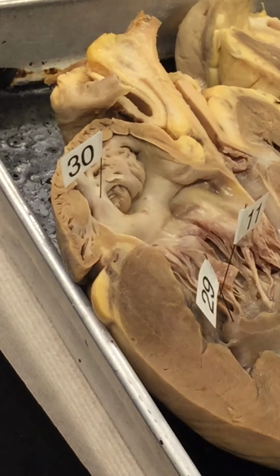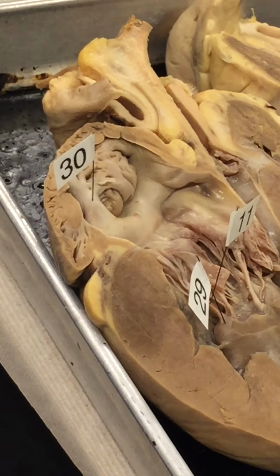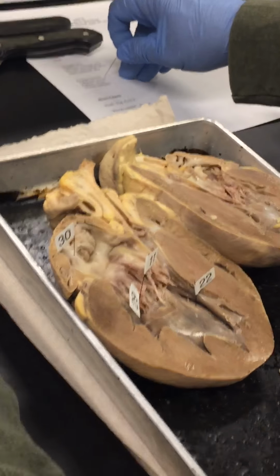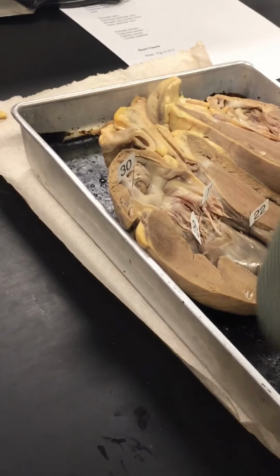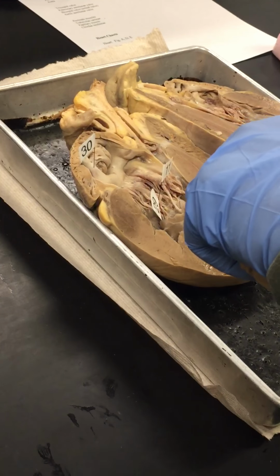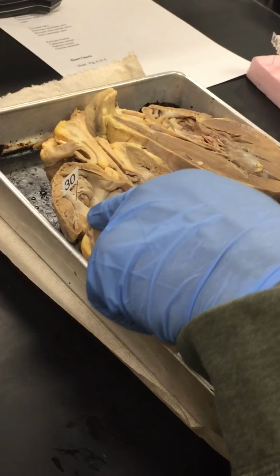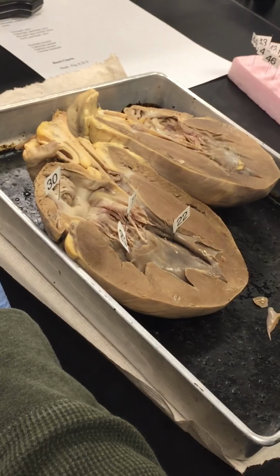30 is pectinate muscle. And it could be either the right or left atrium. And if I ask you on the test to include right or left, then obviously include right or left. But if I just say name number 30, it's just pectinate muscle, like on the list here. Well, you would know because look how thick the wall is over here. If I say include the name of the chamber, then you would say pectinate muscle of the left atrium. Otherwise, it's just pectinate muscle. If you put it extra and I don't ask for it, there are no extra points.